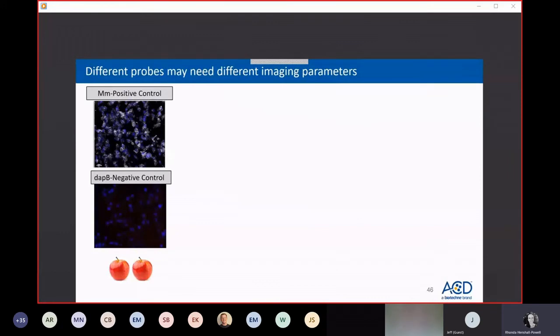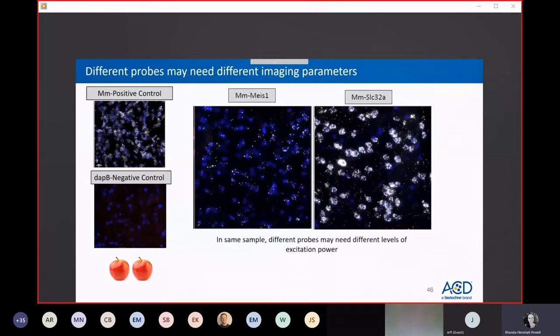Sometimes researchers don't understand that after setting these initial imaging parameters, using the same settings for positive and negative control slides, target probes may require you to adjust imaging parameters to capture optimal signal, depending on the expression level of the gene. So here, for instance, target probe SLC32A1 is a higher expressor than MEIS1. These images were captured with different imaging parameters. You would need more excitation power to see this lower expressor. So if a researcher set their excitation power or exposure time just based on this SLC signal and then put this slide in the microscope, you might be missing this signal generated from this probe.